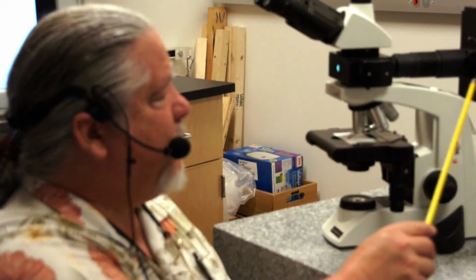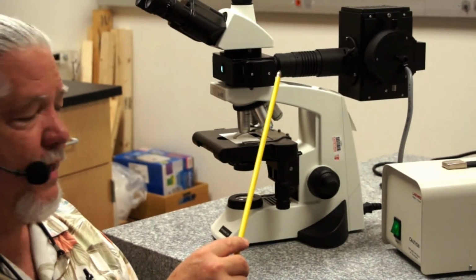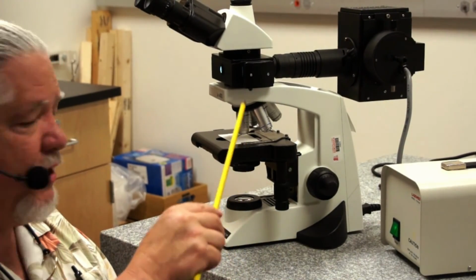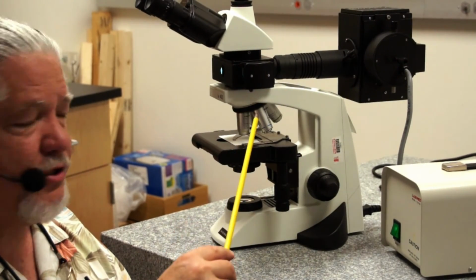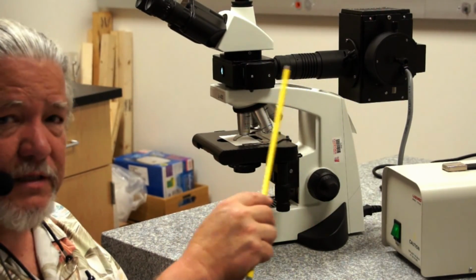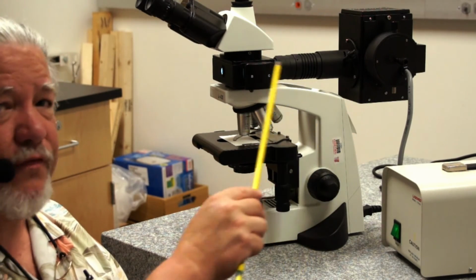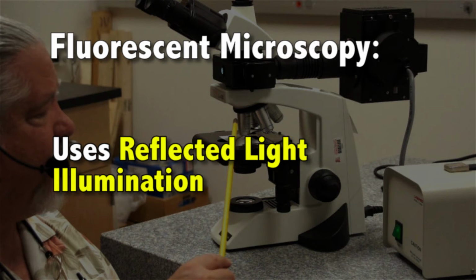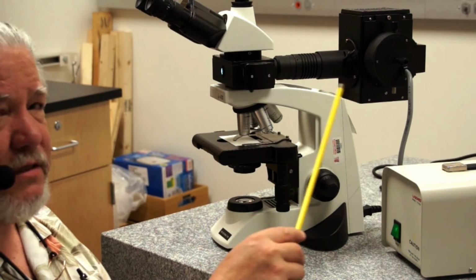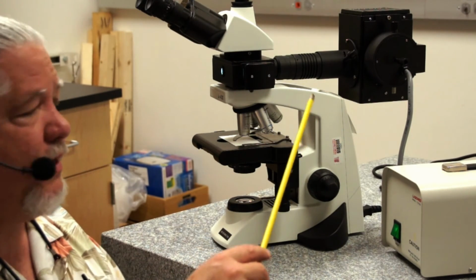We also want to discuss the illumination coming from above. We have transmitted light illumination through the microscope, and we also have reflected light illumination. In fluorescence microscopy, we use reflected light illumination. So let's discuss the components of the reflected light illuminator.